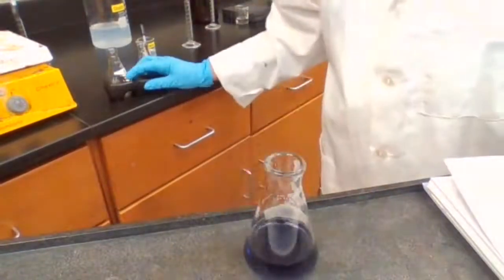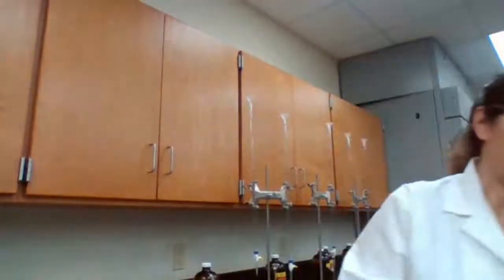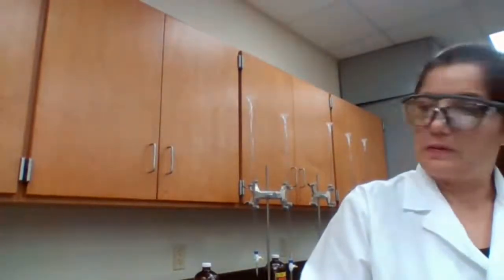Okay, very good. So I have 64 seconds. Time until color change. Trial 2 equals 64 seconds. Okay. We are done with 2 experiments. 2 experiments done.